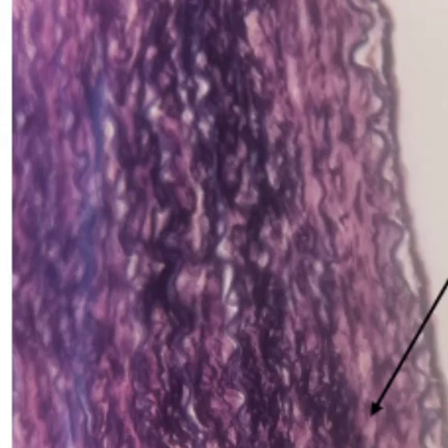As you're studying this, you should compare and contrast the different kinds of tissue so that you see it and you go, oh, I remember that shape. Oh, I remember that shape. Well, this is collagen fibers, but mixed in amongst it are going to be elastic fibers. So if you follow this wavy line right here, that's an elastic fiber. It's going to be able to stretch. So here's another wavy line right there, and there's another wavy line right there.